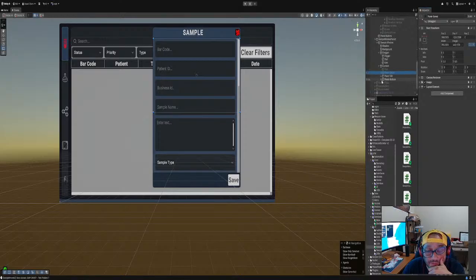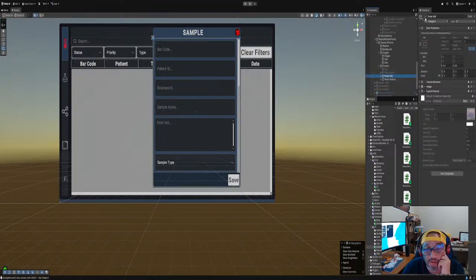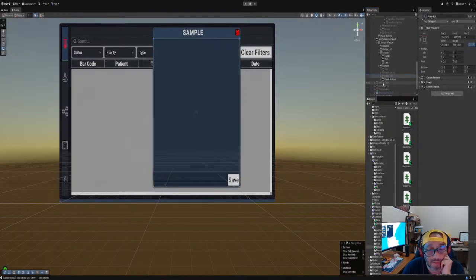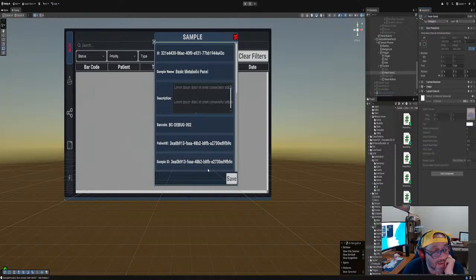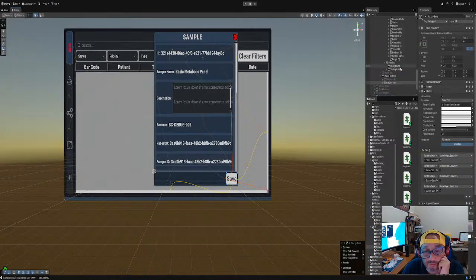Okay, so we have the edit. The edit's automatically on, right? But then we have the save panel. And I think I like this better. So we want the save panel here, and we want to insert all the data there, right? So when you saved it, there should be a button here. What's the button to save? Okay, here goes the save button.